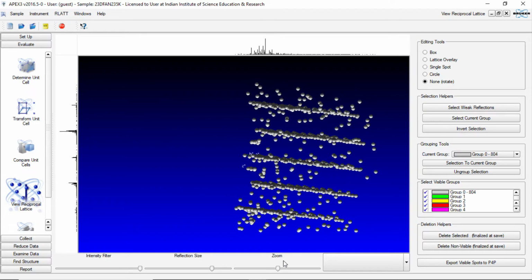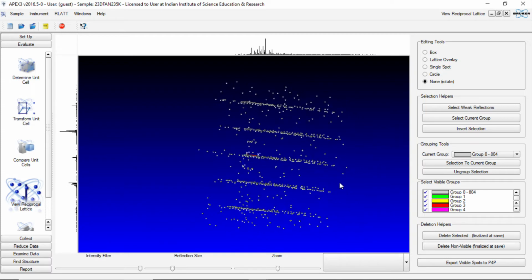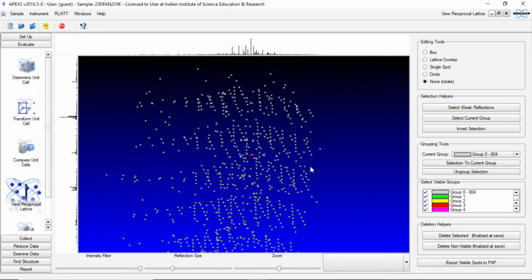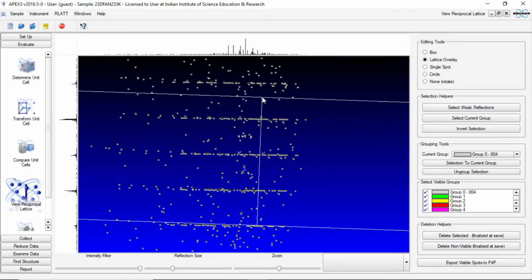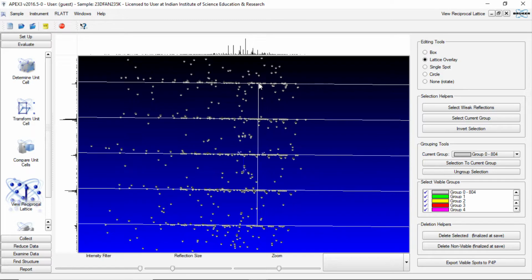First thing that we need to do is to reduce the size of the reflections so that the overlap region is reduced, and then we zoom in and try to see in what plane they are nearly matching. The ones which are completely out of those planes, we want to throw away. So we will do a lattice overlay and take from here to this point, and we will press the button plus. If you press the button plus, you see this window gets split into parts, and it gives you lines parallel to the lines where the reflections are aligned.